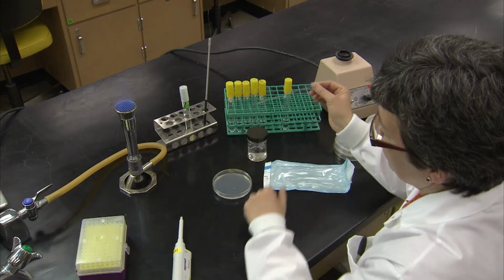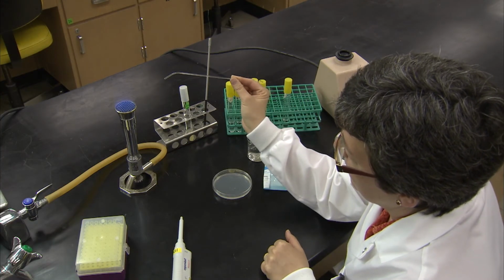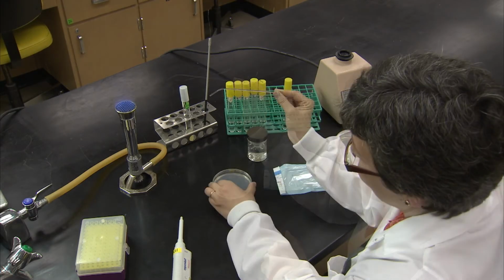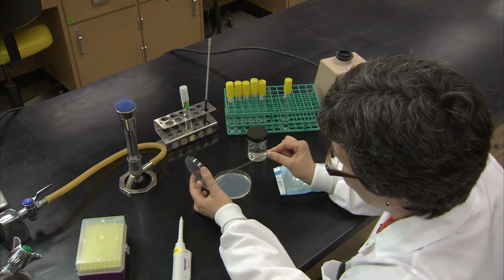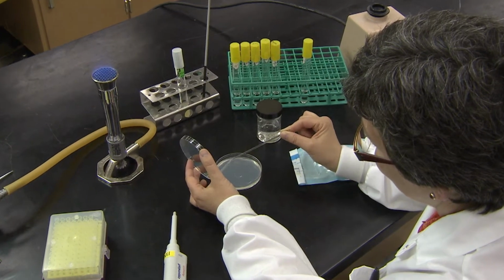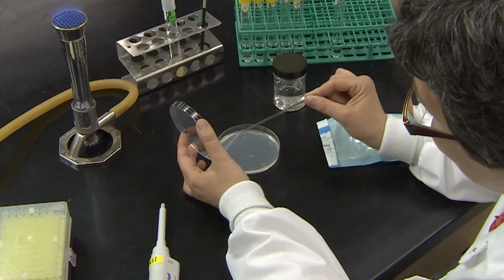metal, is sterilized by dipping it in alcohol and setting it on fire. After the alcohol burns off, the spreader is allowed to cool. Check that the spreader is not too hot by placing it on the plate surface away from the culture. This will also help to cool the spreader as the heat is transferred into the plate.